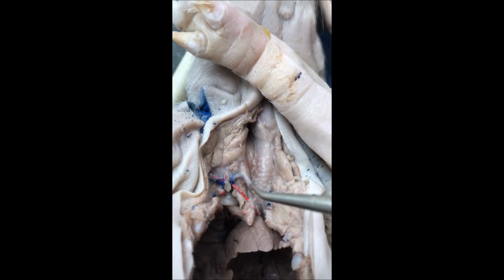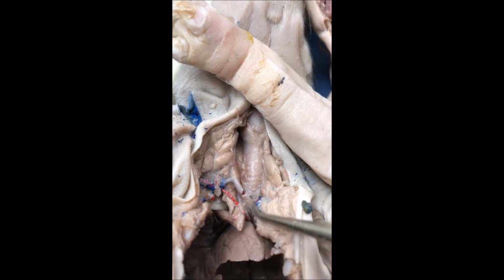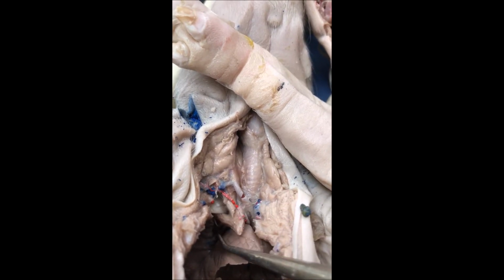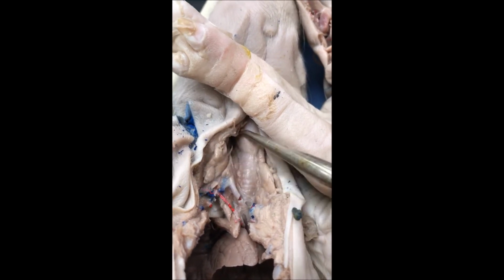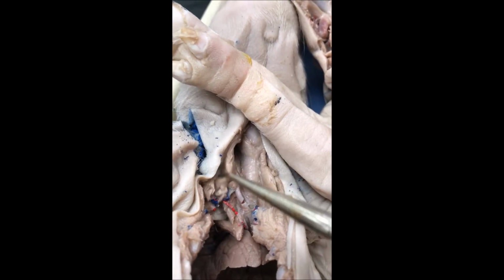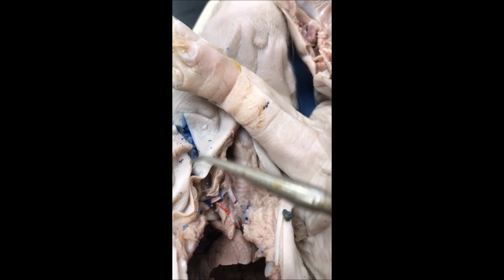Up in the throat of the pig, a couple of arteries to know. You have right here the brachiocephalic artery, and then you have the brachiocephalic vein that dumps the blood into the vena cava. The brachiocephalic takes the blood up to, and these haven't been dissected out, but right here is the carotid artery, and then over here through this thymus would be the jugular vein, nice and big and blue. There's a little part of it right there.